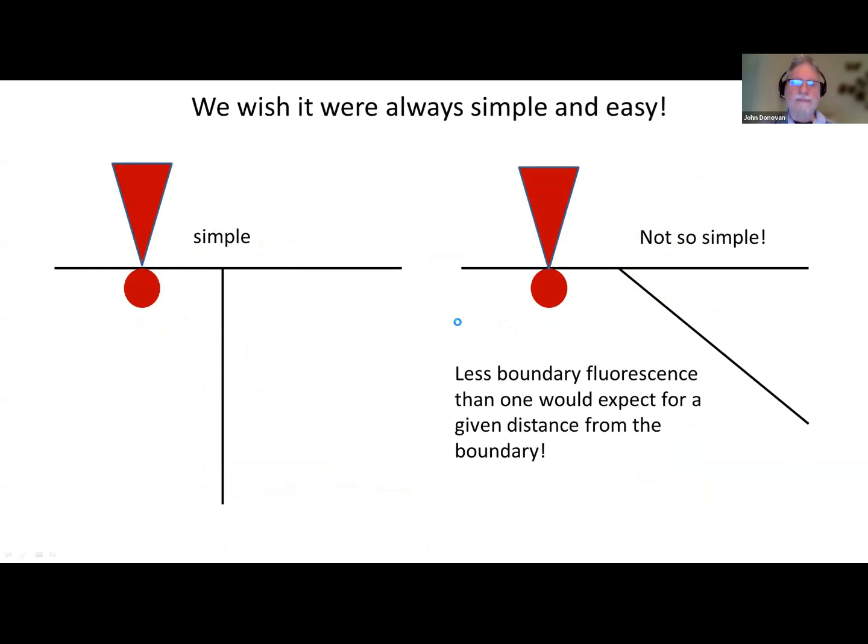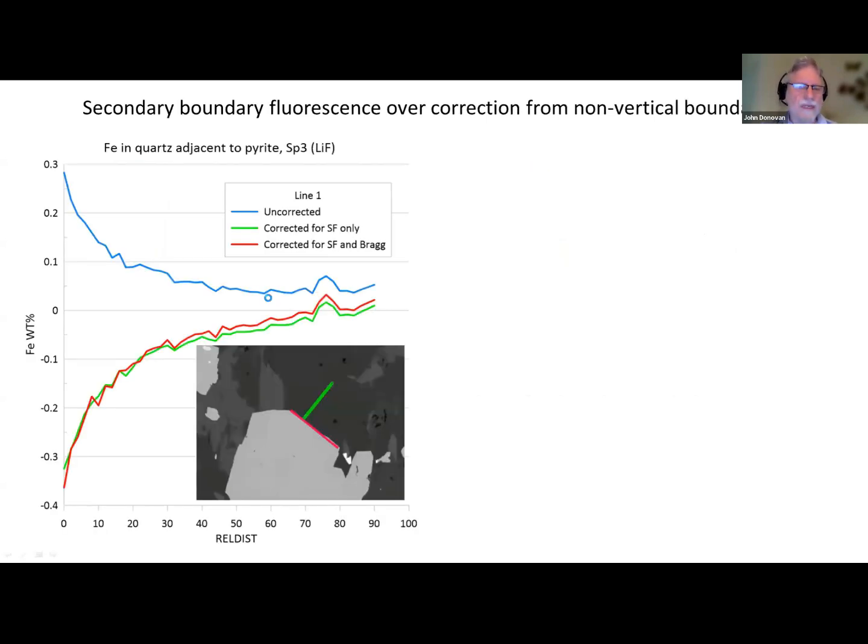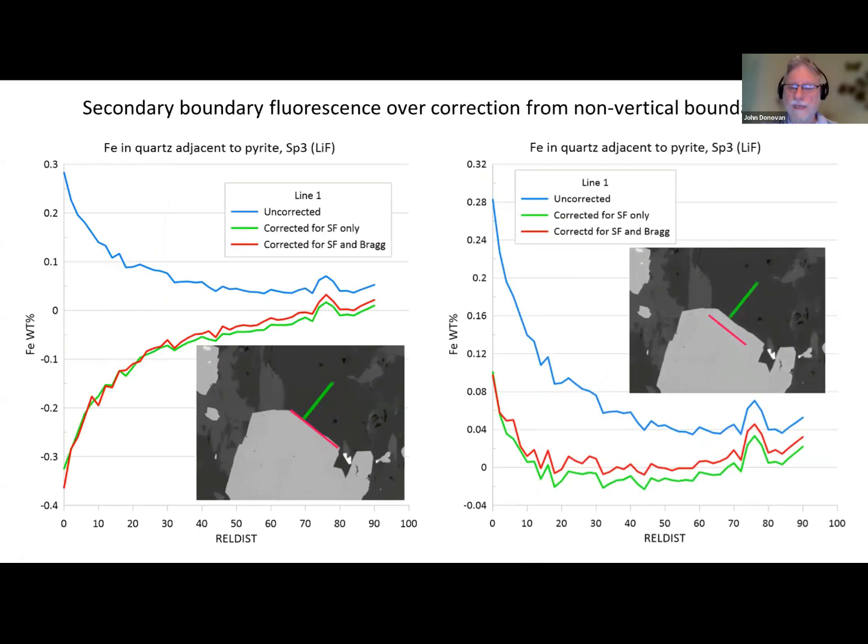So that's a problem. And how would we even measure this angle in our sample? You need to have a SIMS depth profile, and then it's destructive, so you've lost it now. Just to point out in this particular example that Glenn did for me, this material here, I believe, is a very sloped interface, because if I apply the boundary right there where it appears to intersect the surface of the sample, we actually overcorrect enormously. But if I move the boundary over to here, then it does a pretty good job.